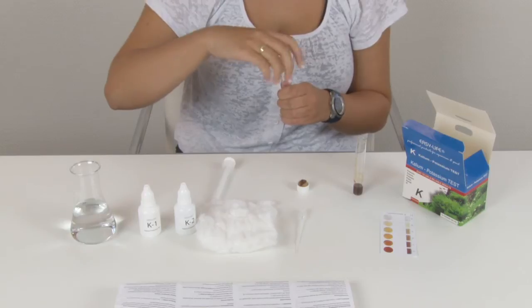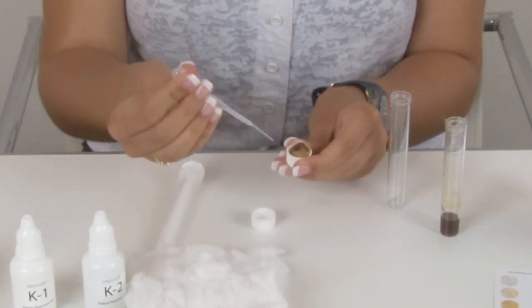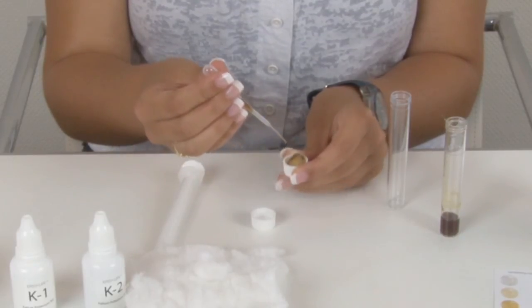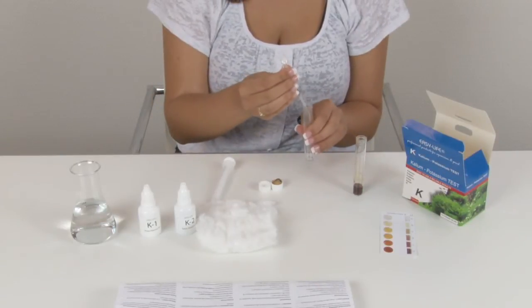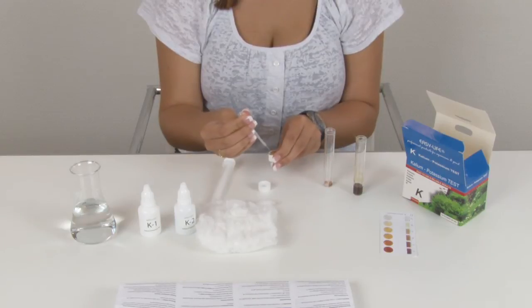Uncap the test tube, squeeze the pipette and stick it gently in the cotton, and fill it slowly with clear liquid up to the mark if possible. Grab the second clean test tube and fill it with clear test liquid till the height indicated on the ColorChart.